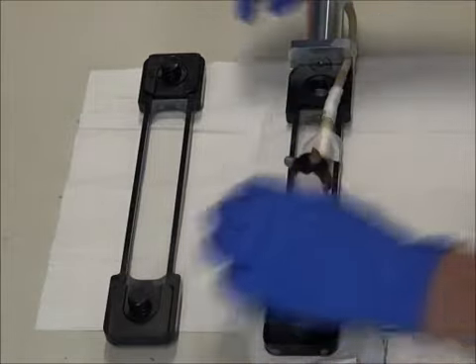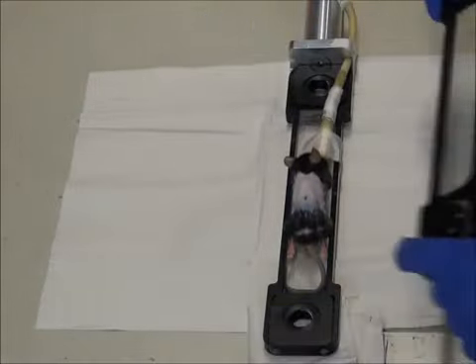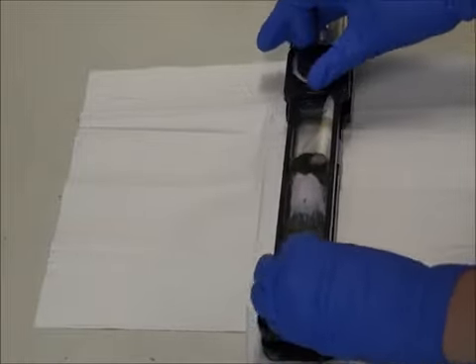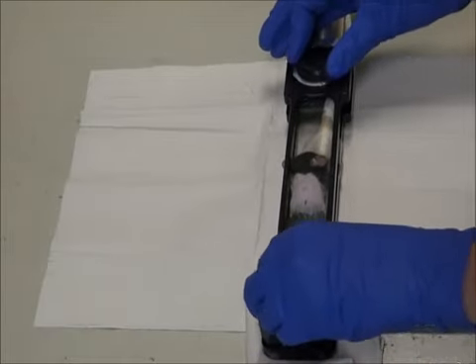The mousebed is closed and the depth adjusted to tightly hold the mouse in a fixed position. Be careful and monitor the breathing, because tightening the bed too much can suffocate the mouse.